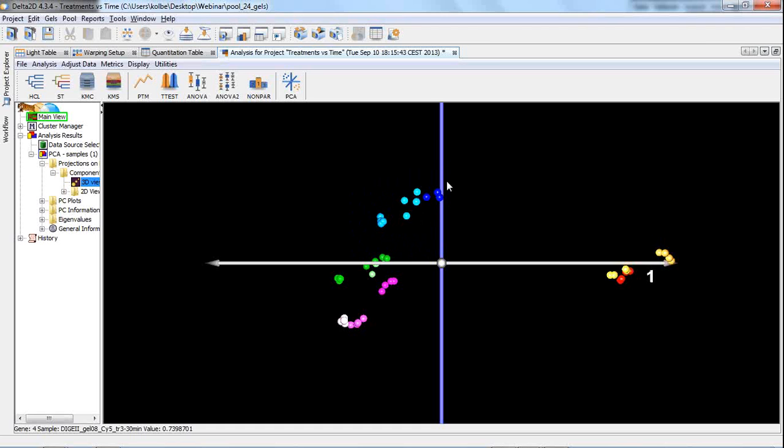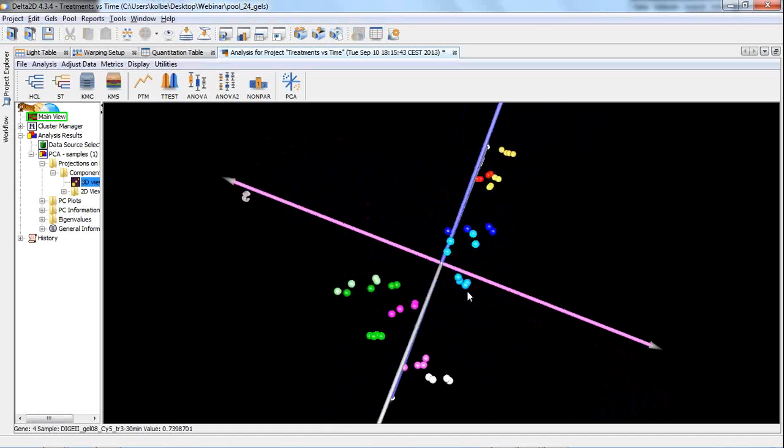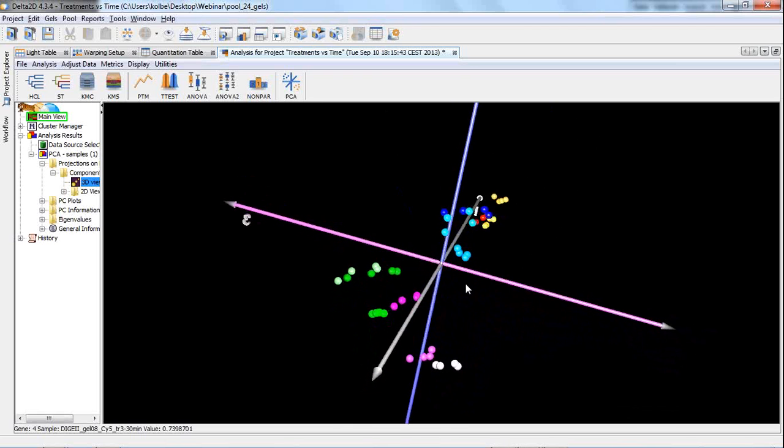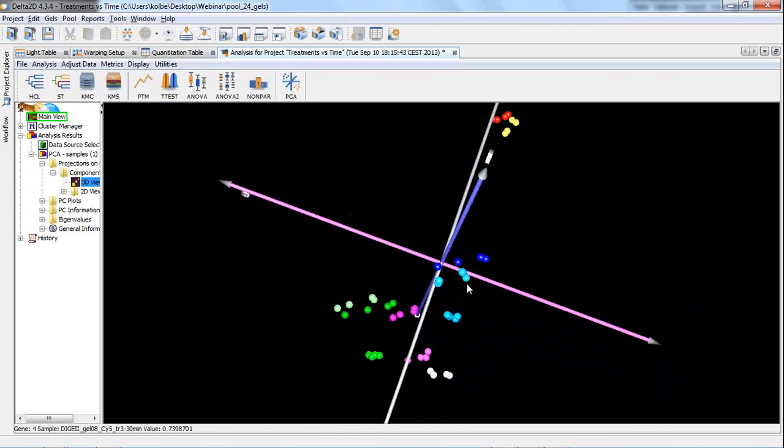the cell lines are clustered together. So here you can see the shades of blue for the cell line control, and here are the green ones together for the cell line treatment 1, for example. This is a 3D view. I can now rotate it so that you see that this is looking rather nice. You can see maybe that here these two groups of green are close to each other, so the similarity within this cell line is very high.